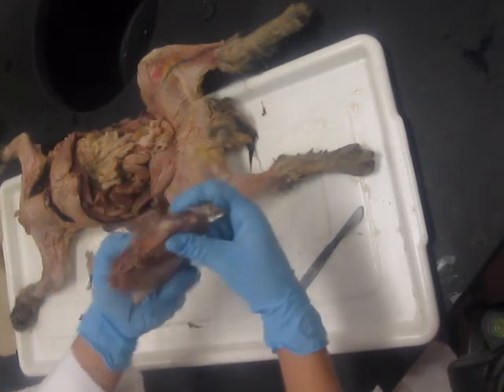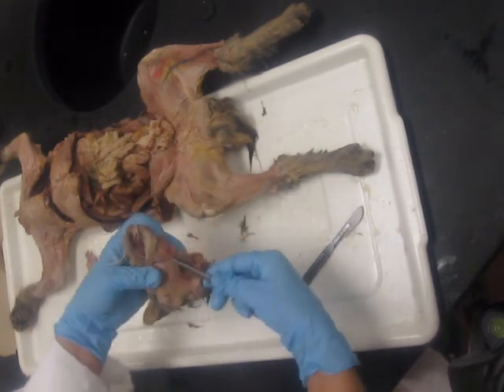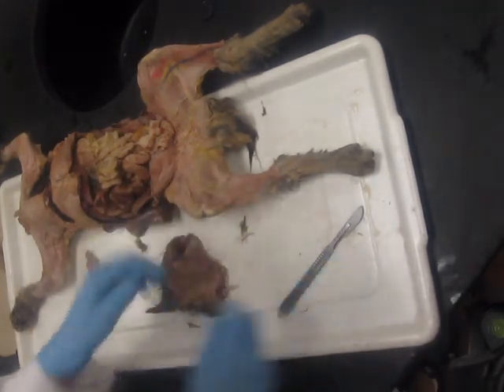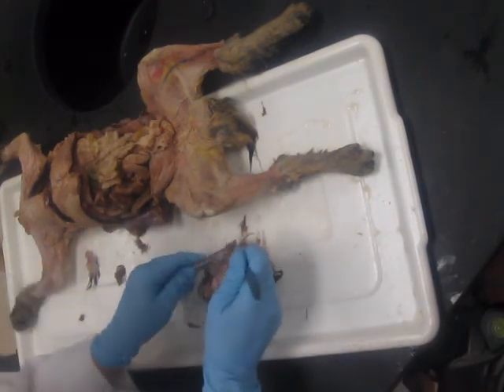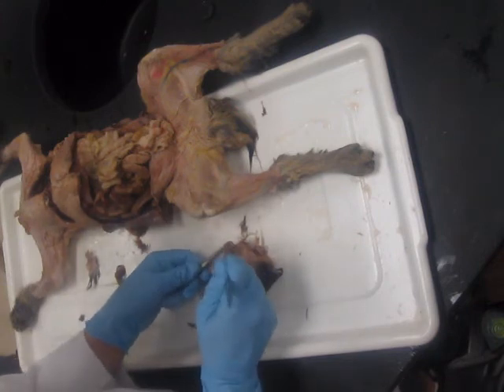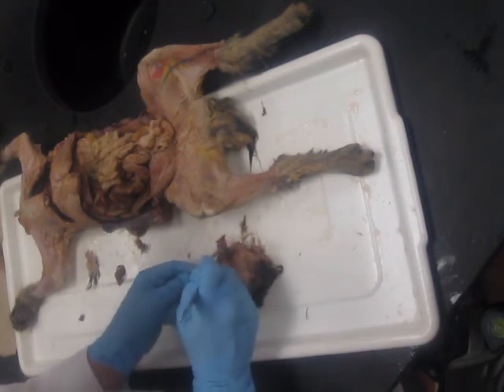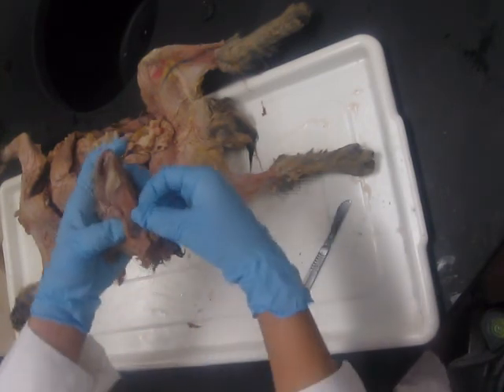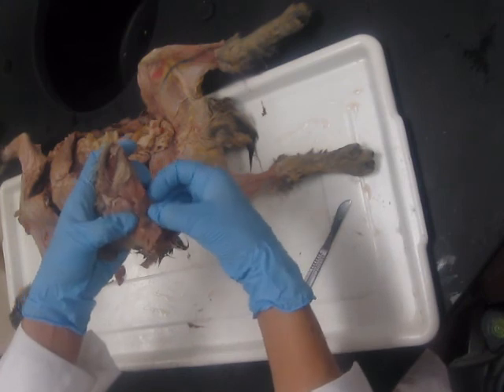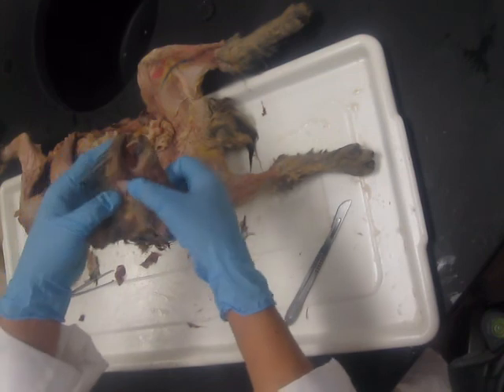Okay, now the submandibular is going to be right underneath that. So again, we have some tissue here to remove. This is hard to do without someone holding this for me, but pull and remove. Get between the tissue and the gland. Like that. Okay. And there's our submandibular gland. The vein going through there. Okay, submandibular, parotid, masseter muscle.